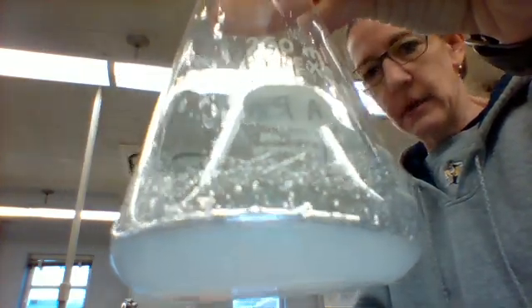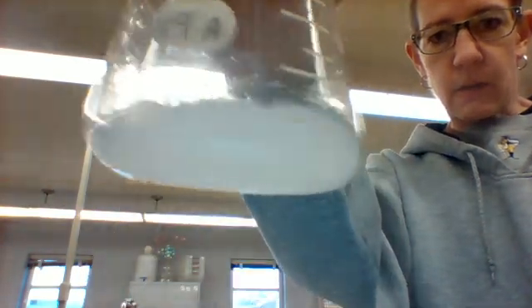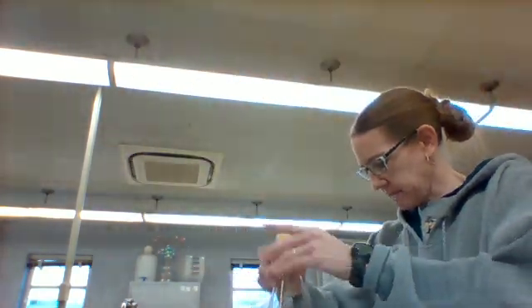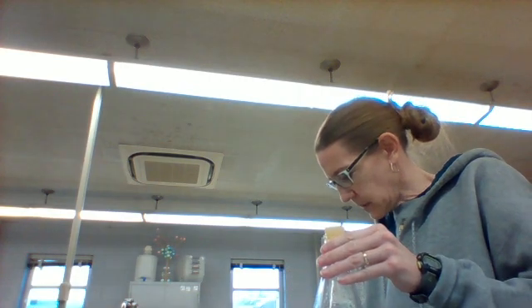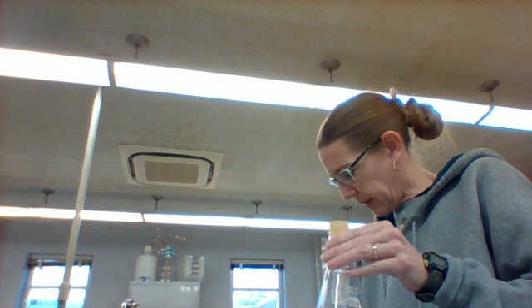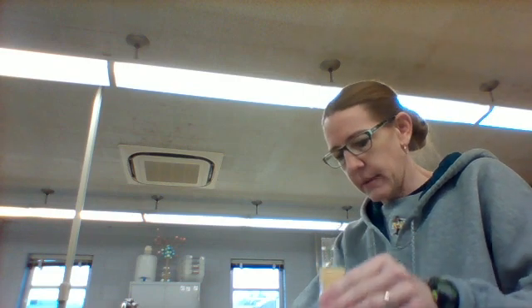A reaction has happened. We formed a new product, and it looks very different, kind of chunky, like the stuff that's in a diaper if a diaper gets wet. That's what it looks like right now. So I'm going to restopper everything, put everything back on and take our mass again.